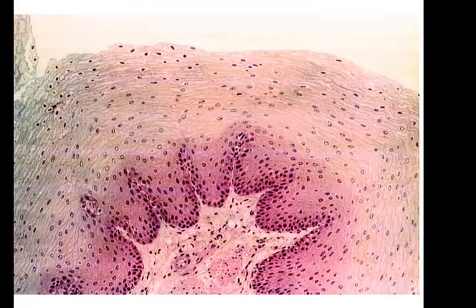Now we're going to move on to our actual layered stratified epithelium, and this is stratified squamous epithelium, and there are going to be two types of stratified squamous epithelial tissue. There is the non-keratinized version and the keratinized version. This is non-keratinized, and where this starts, you see these little papillae down here. We start from here. These are where the cells are actually living and reproducing, and then they push the cells all the way up to the surface here. Here's the outermost surface, the part that you would see.